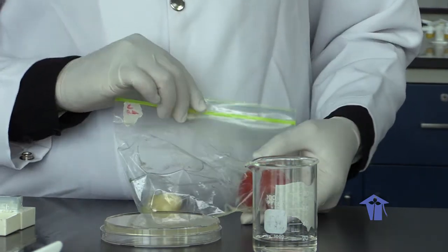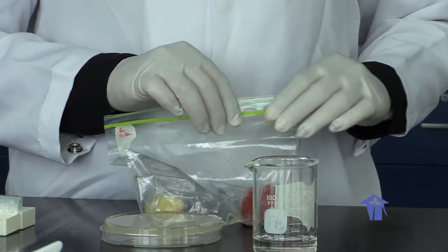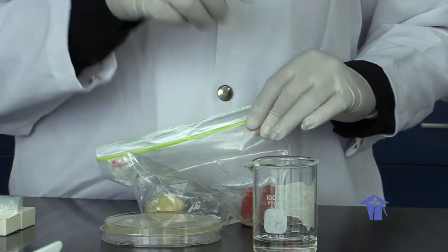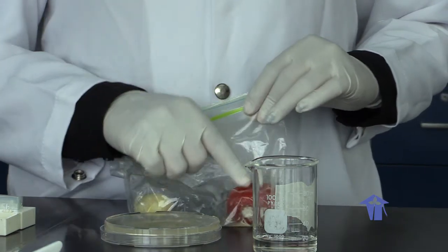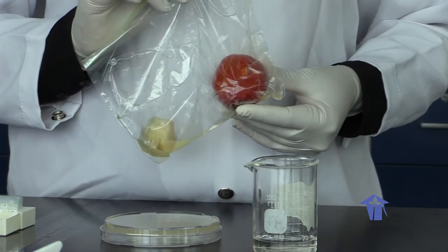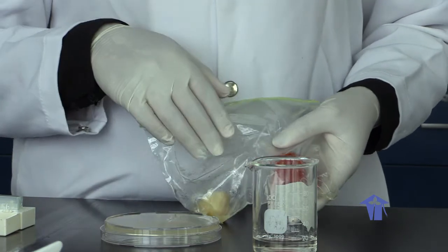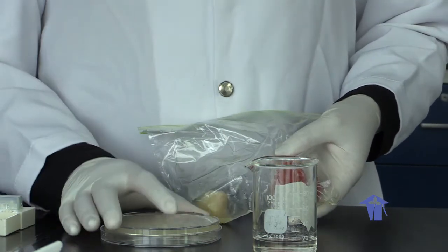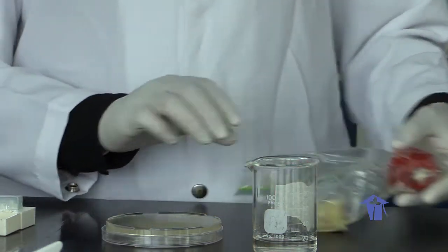The idea is that the organism that would have caused the disease in our first initial sample is the same organism that we would have isolated from that lesion, placed and re-inoculated into a healthy organism. It caused disease in that healthy organism, and when we isolate it, it will be identified based on colony morphology and characteristics that it was the same organism causing disease in that first tomato.